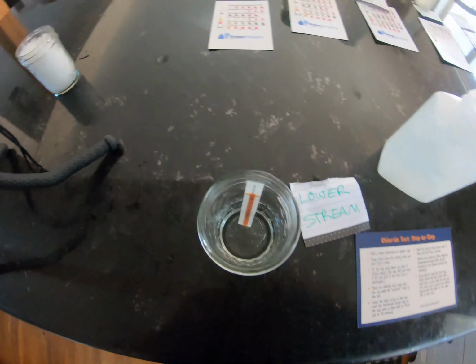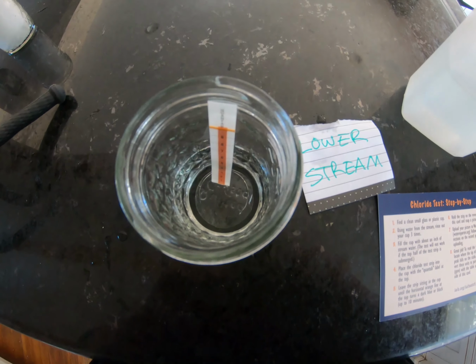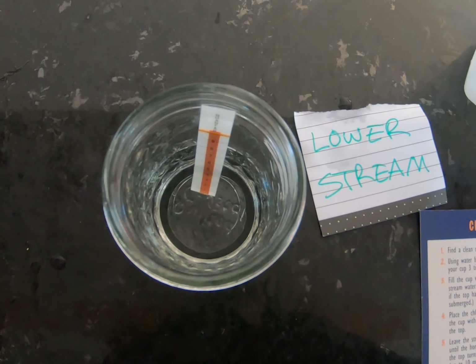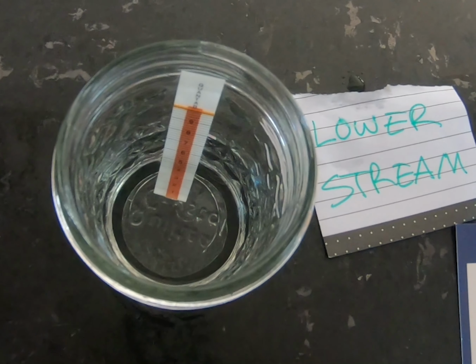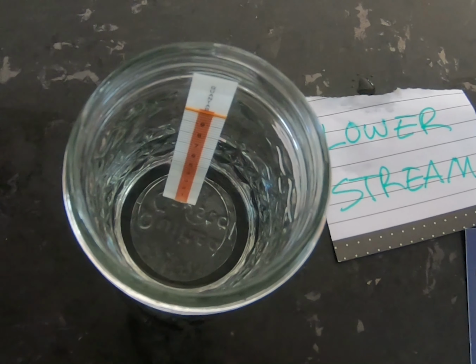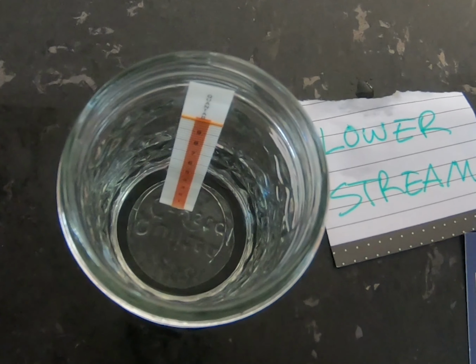These strips work differently than the Water Insights ones. You place the strip into about an inch of water where the top half of the test strip is not submerged in the water, only the bottom half is. You then wait for up to 10 minutes for the vertical orange line to run up the test strip. You know the sample is done when that horizontal line at the top of the strip turns black.